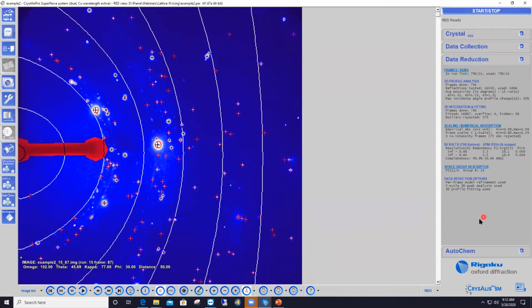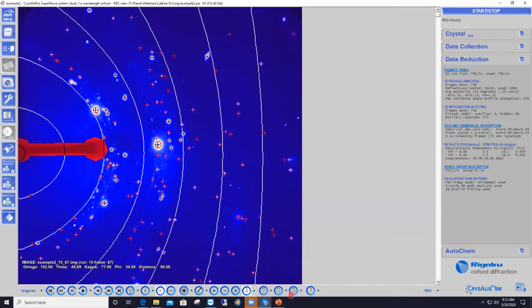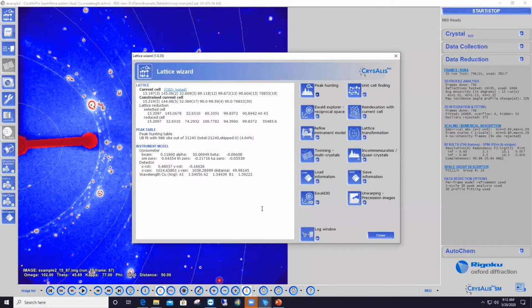Okay. So now let me jump to another instance of CrysAlisPro for that same data set, where I gathered the data only from the dirty scans. To show you what I did, this is the Lattice Wizard interface that is already open here. From the peak hunting feature, I click on the little arrow button to have access to more advanced options, and I select here peak hunting with user settings.